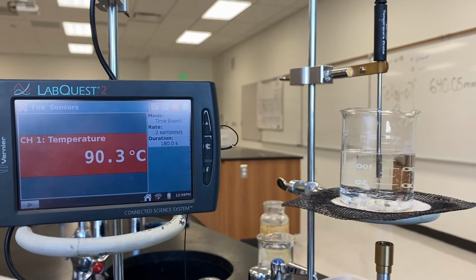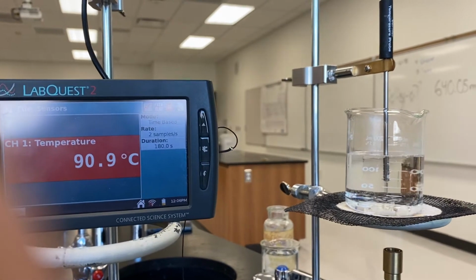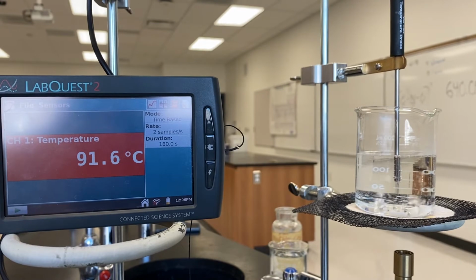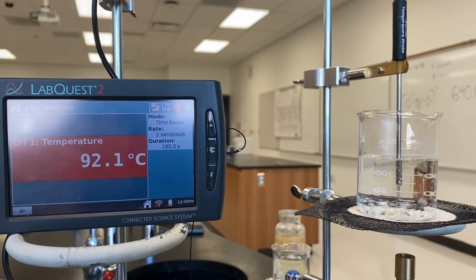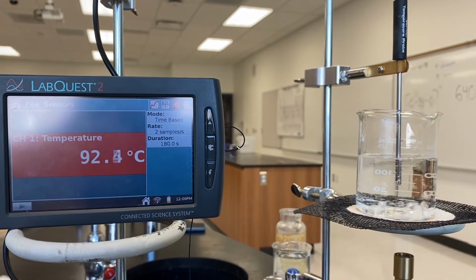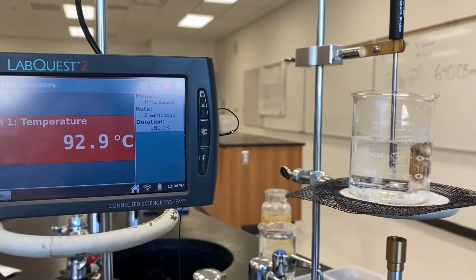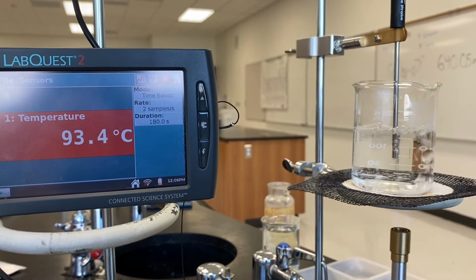All right, we're back. We're probably 4 or 5 minutes into the boiling process, and you can see on the thermometer that we're now in the 90s. And as we get up into the 90s, the water begins to boil a little more regularly. What we want to do is keep our eye on that thermometer, and we'll see that the rate at which the temperature changes will begin to slow down.